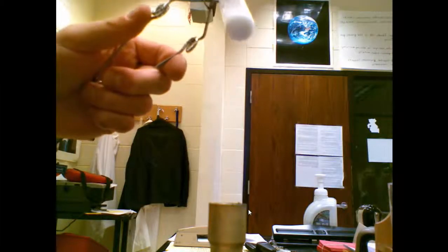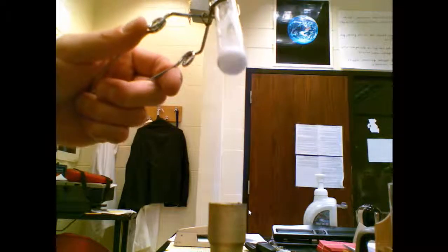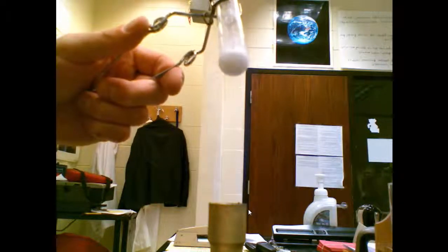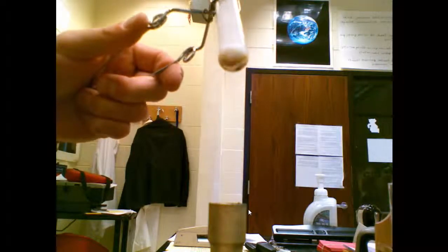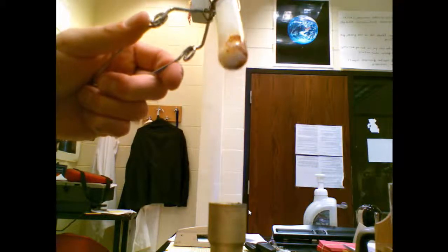Take crystal number two, white granular solid. Put it in the Bunsen burner. Okay, it's just starting to melt right now. The flame hasn't turned yellow. It didn't melt immediately but melted before the flame turned yellow.